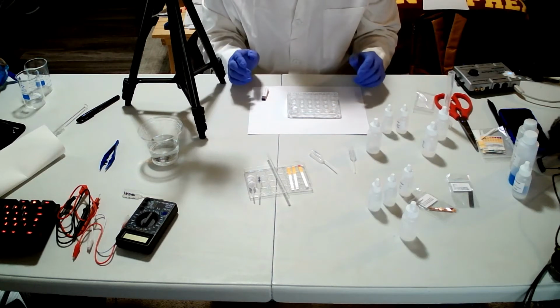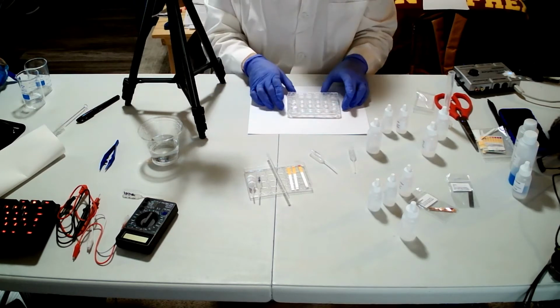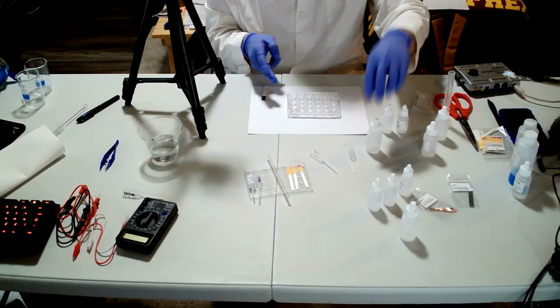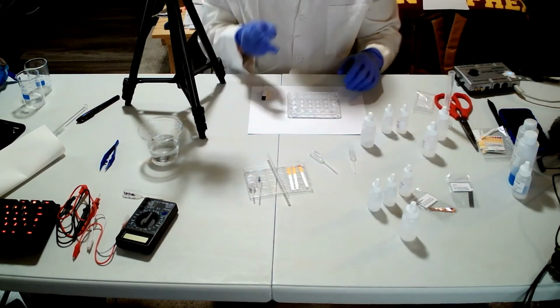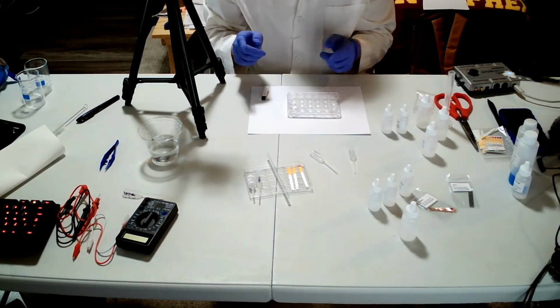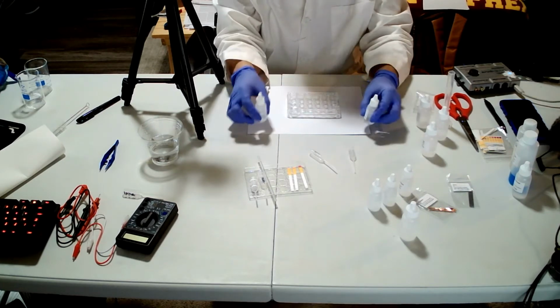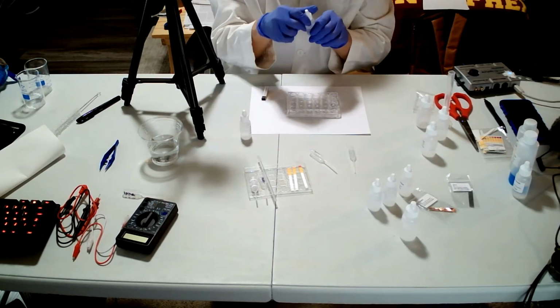So hi guys, this is the third video for using buffer. I already have added A1, A6, B1 mixes with the vinegar given in the hands-on lab. I filled up each one of them with 2 milliliters. So that is hydrochloric acid and sodium hydroxide. Let's assume this is 6 molar.